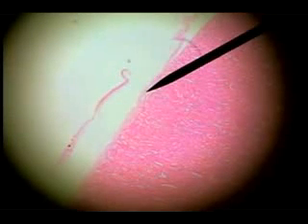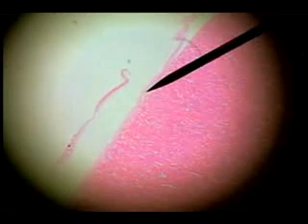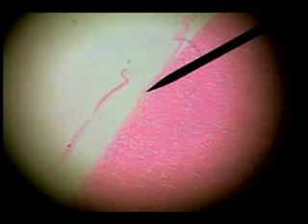The major organ of the urinary system is the kidney. There's an outer connective tissue capsule on the surface of the kidney, and you can see the capsule pulled away here. And as we scan in this denser outer surface, this is the cortex of the kidney. As we scan toward the deep surface, this is the lighter medulla of the kidney.